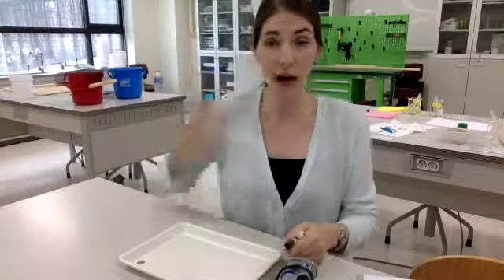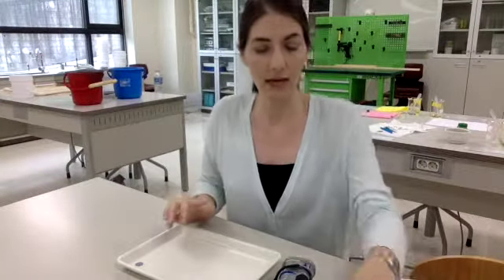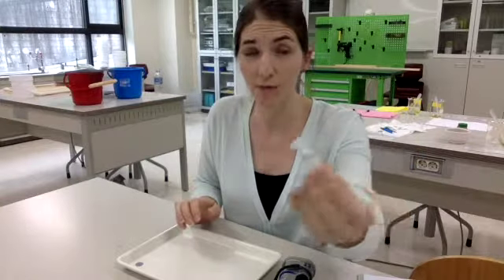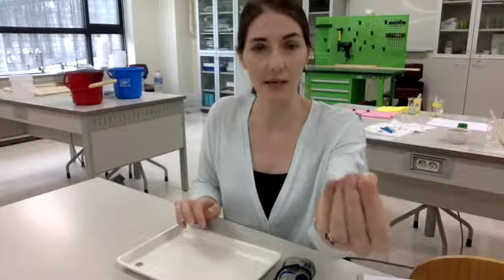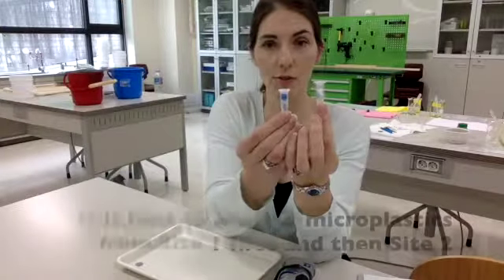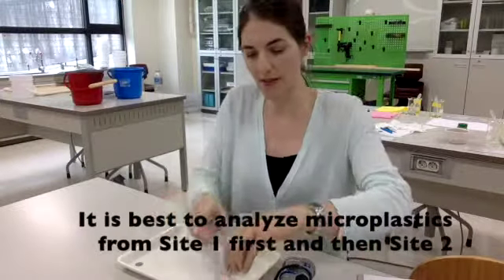Okay, so now I'm ready to go ahead and analyze and fill out my data table. First of all, I have my microtubes that are full of microplastics, which can be styrofoam, which is actually polystyrene. It can also be plastic from plastic bags. It can be plastic from almost anything. So the first thing I want to do is go ahead and pour them onto my tray.